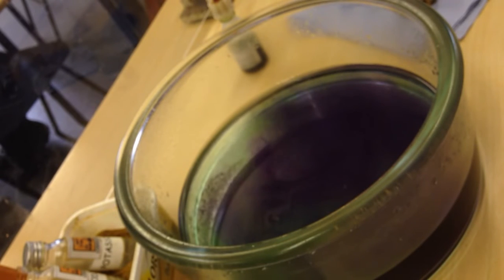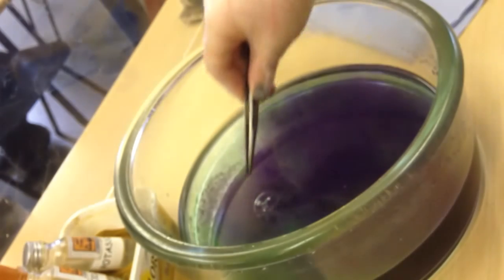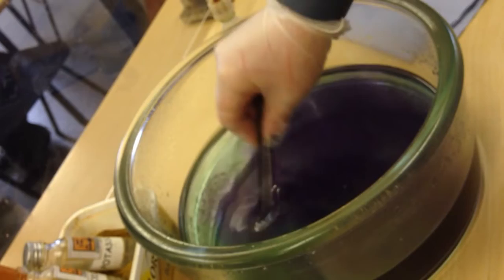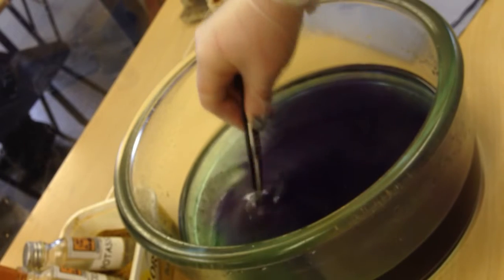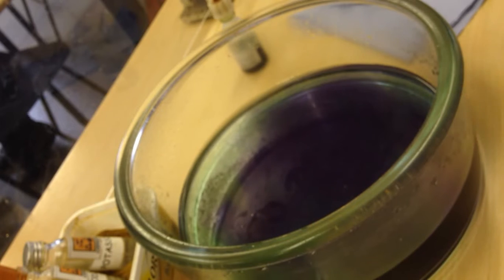Ready? No, it is working. We just need to give it a bit of a nudge because it's all covered in oil. Bit of a nudge, come on. This one won't do, but we might be able to get potassium to catch on fire.